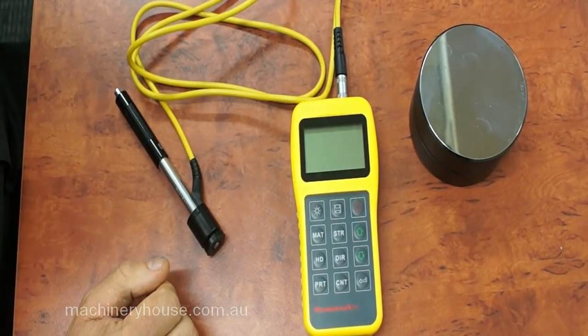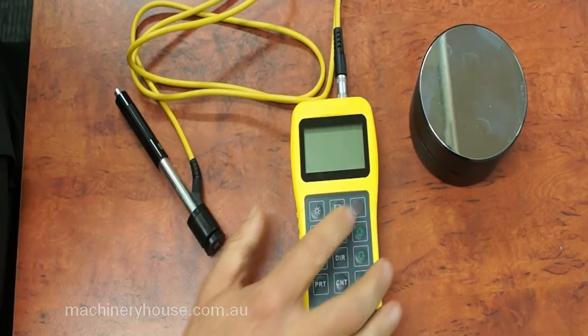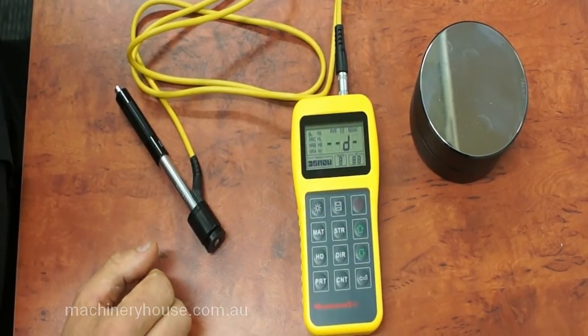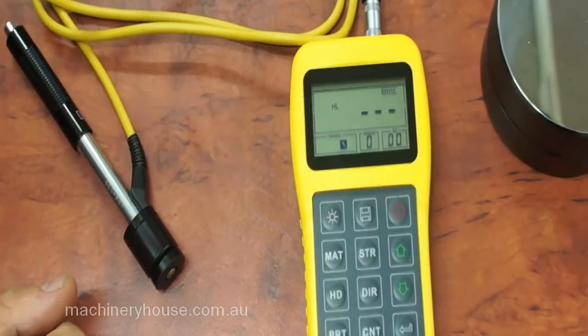On the keypad, press the power button to bring up your test screen. The main interface should now be displayed.